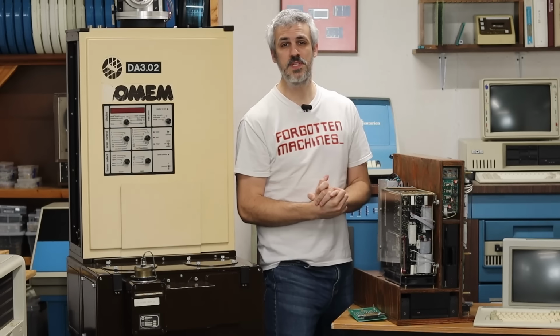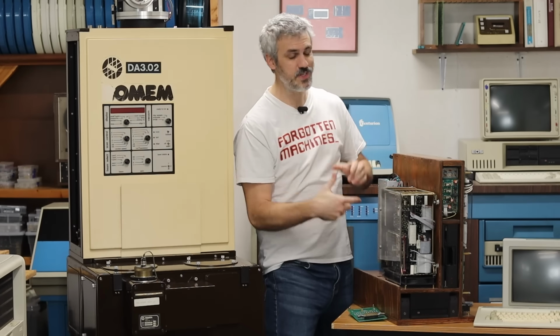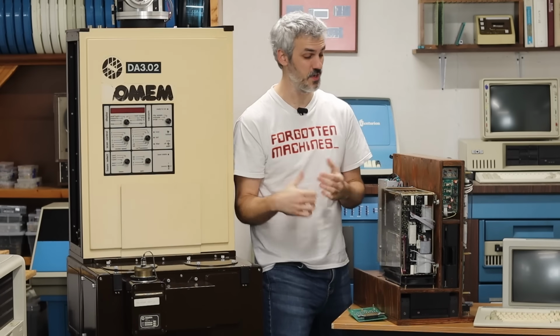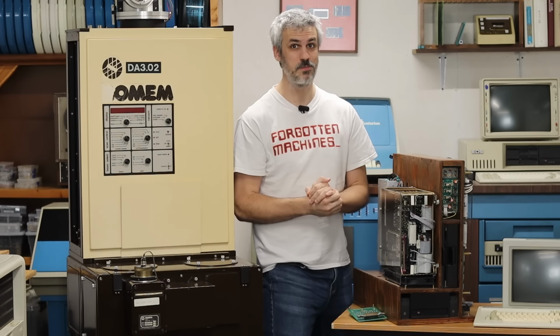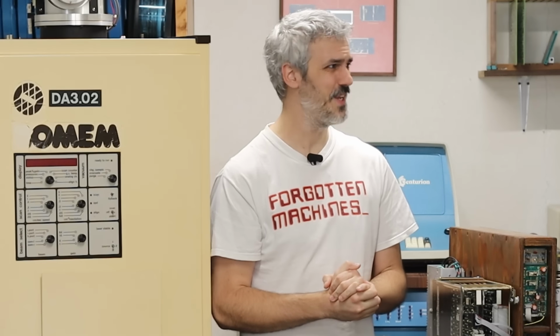This is a Bomem DA-3 Fourier transform infrared spectrometer. And this is a PDP-1173 with a high-performance vector processor. These two things are supposed to talk to each other, and they currently don't. So let's make them do. Let's make them do? What kind of English is that?